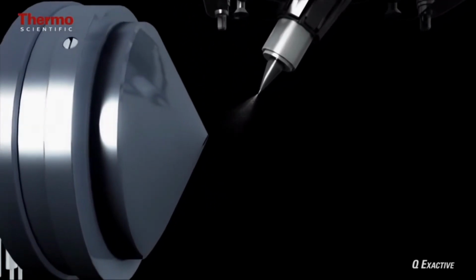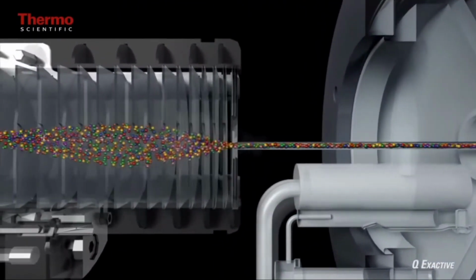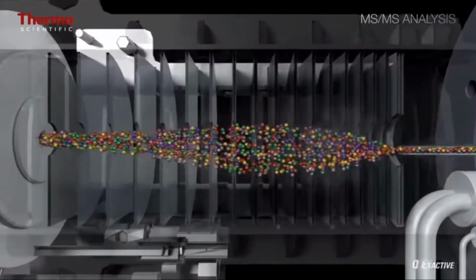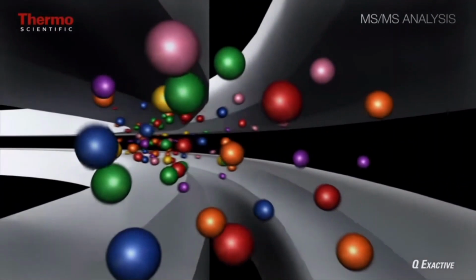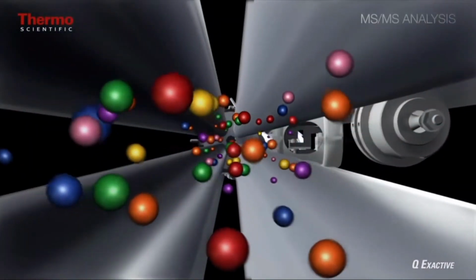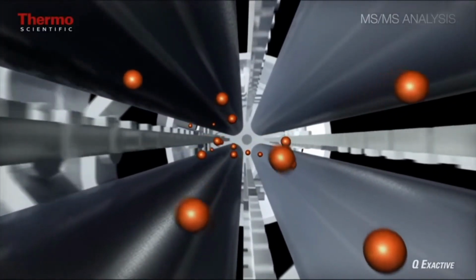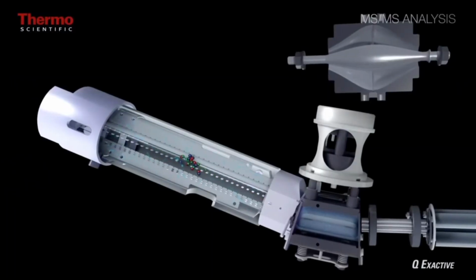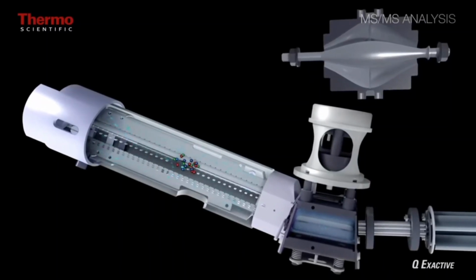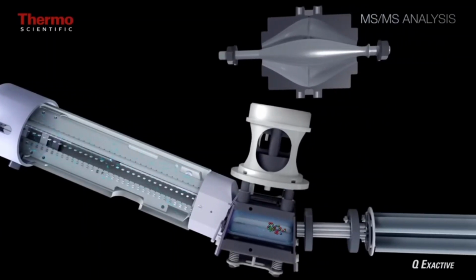Likewise, the dependent scans are parameter rich as well. Again, we see a different group of ions entering the mass spec, traveling through our lenses. And in a moment, we'll get to see the mass filter in action, selecting that precursor species that we decided upon from the survey scan. So we have all our different ions. We have only this single precursor species remaining. It's going to enter the collision chamber. And in the collision cell, you have a determination to make about what your fragmentation energy is going to be. Are you going to bias this more for fragmenting your reporter ion? Do you want to get more diverse fragments from your precursor species? Considerations that one has to make. Collection time, again, for the fragments is another consideration.